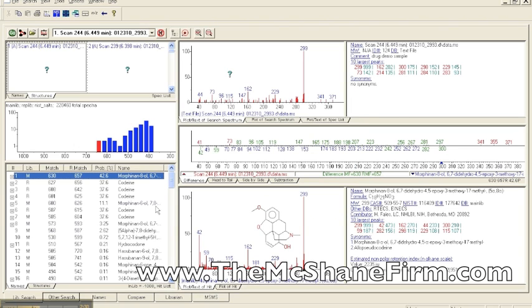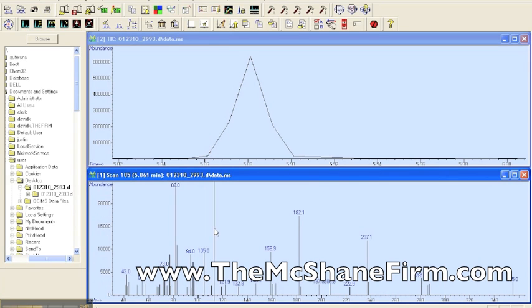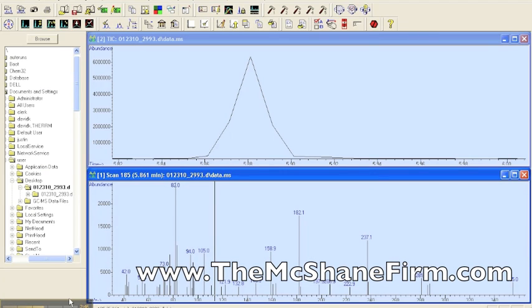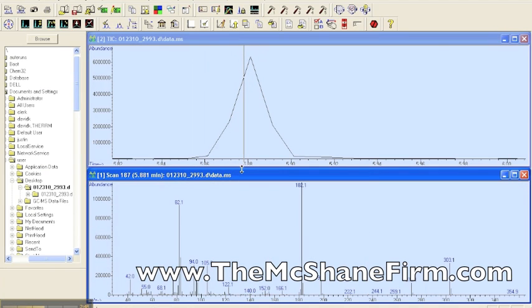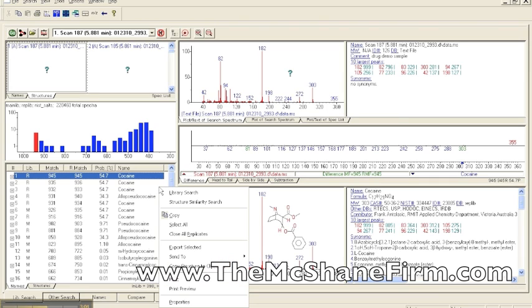But probably one of the most useful ones that isn't provided to us is this match factor. So let's go back to our allo pseudococaine example. So allo pseudococaine, that's there. And then we go back over here and we right double click and we come up with cocaine. And if we just did the first three, then, hey, it's cocaine and it's got these match factors. There's not even another thing on there. But obviously, number four, if you're in a state that doesn't outlaw allo pseudococaine, that would really matter to know, and especially because the match and the relative match factors are good.